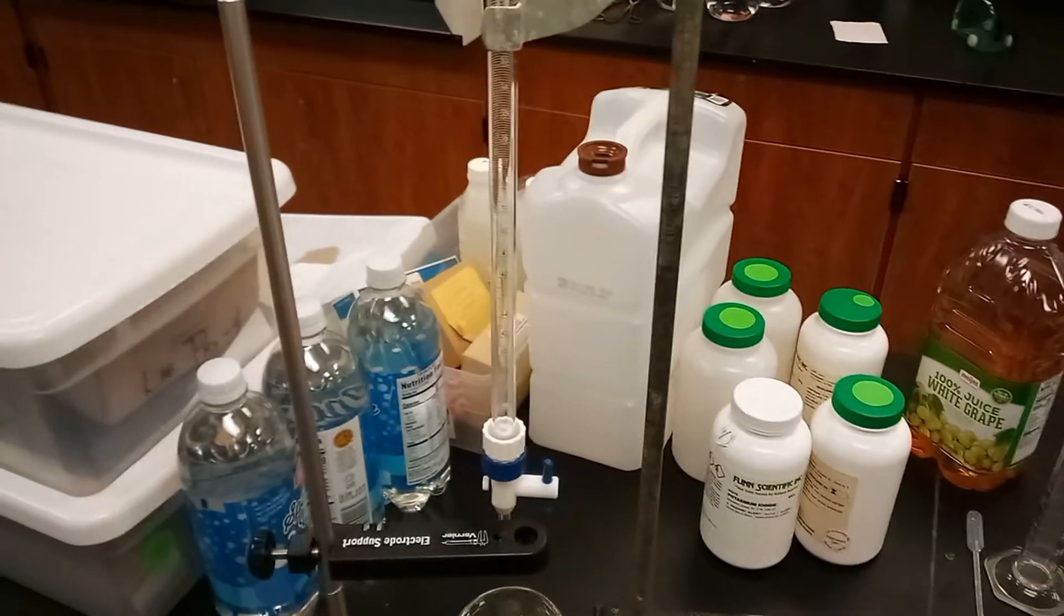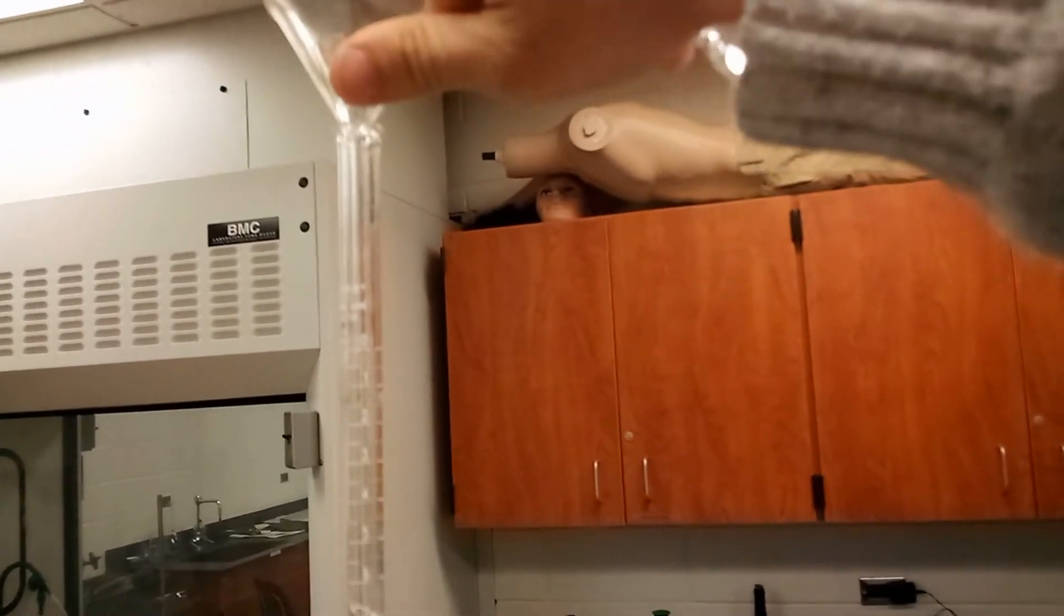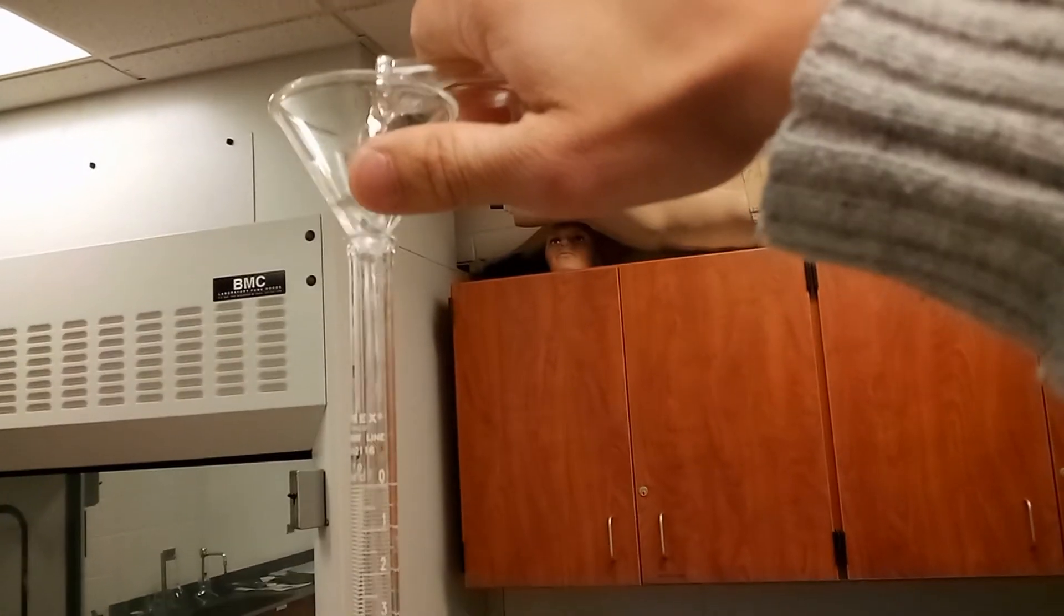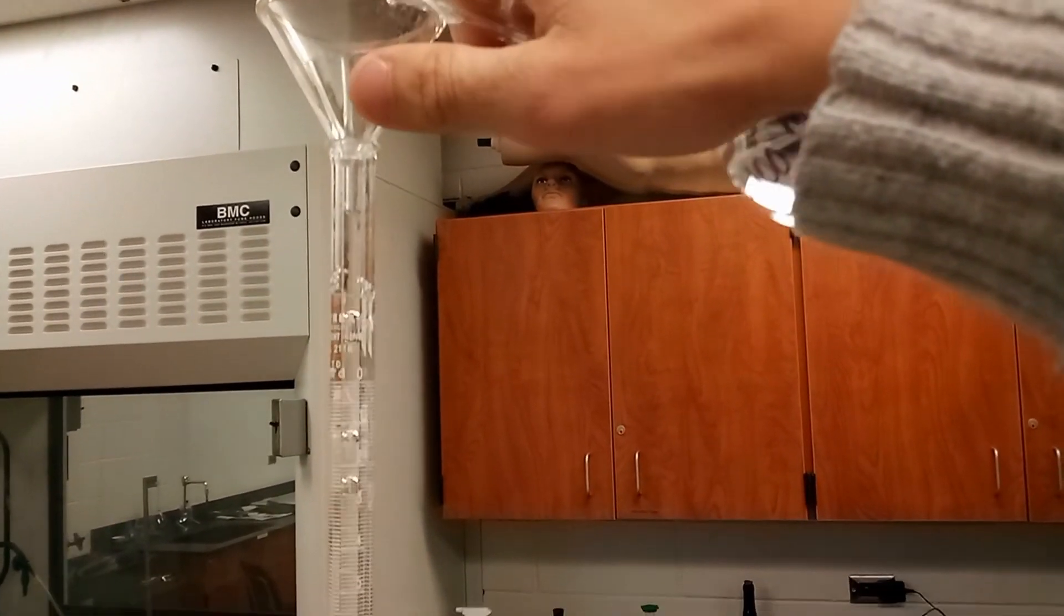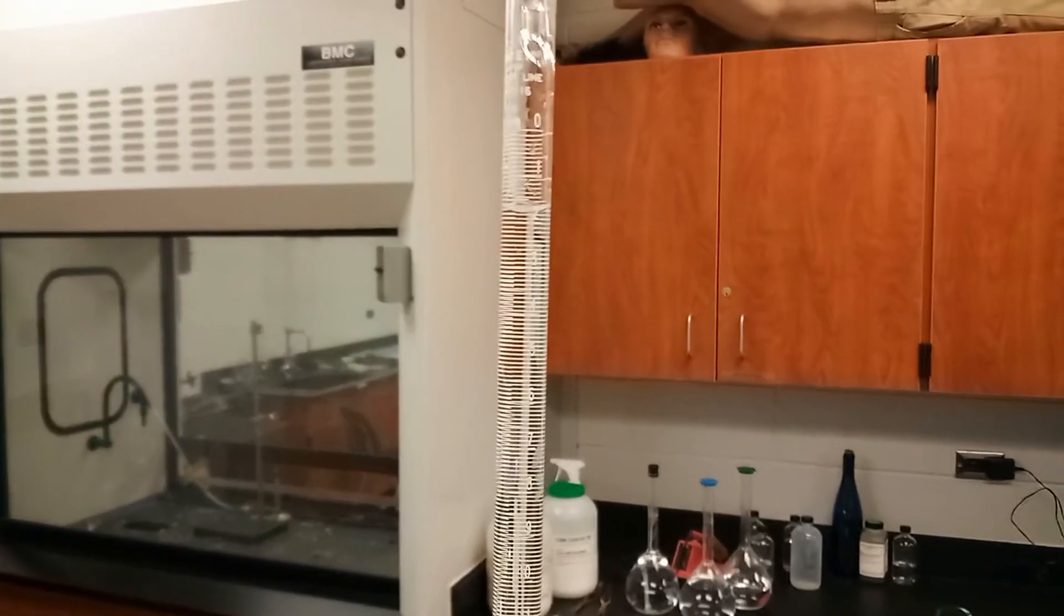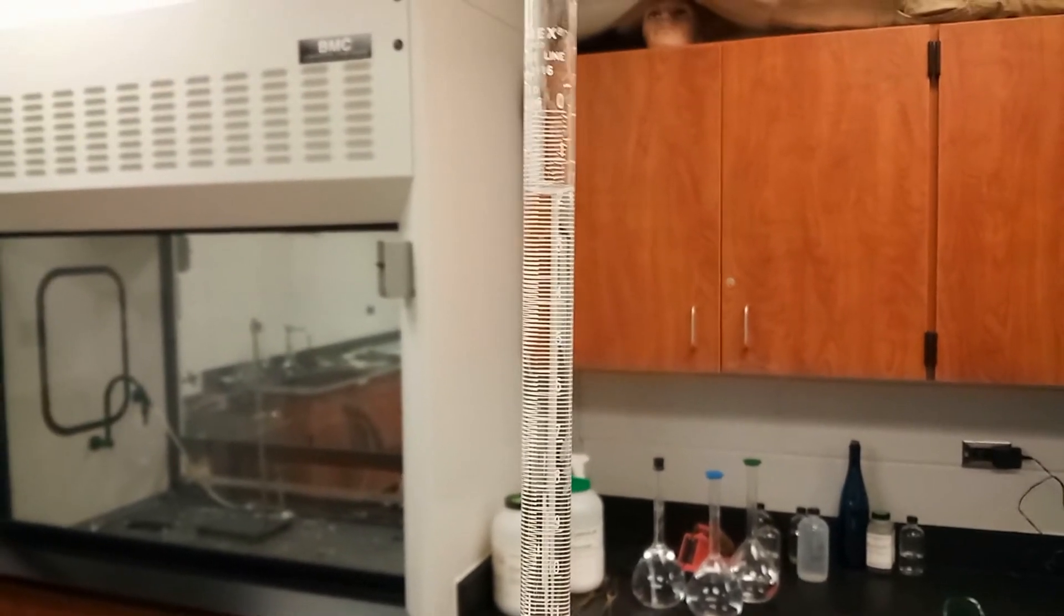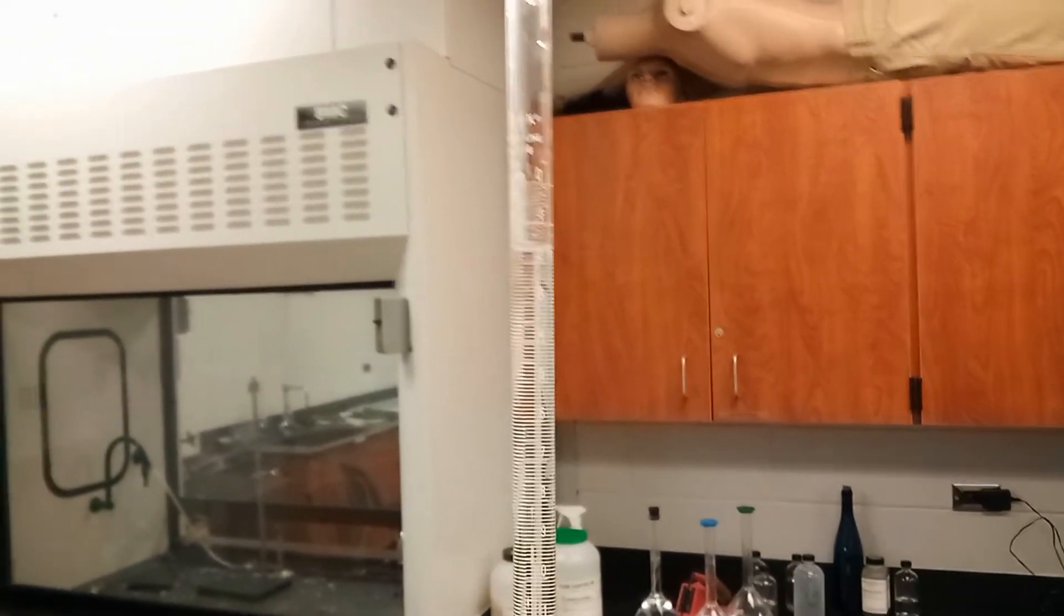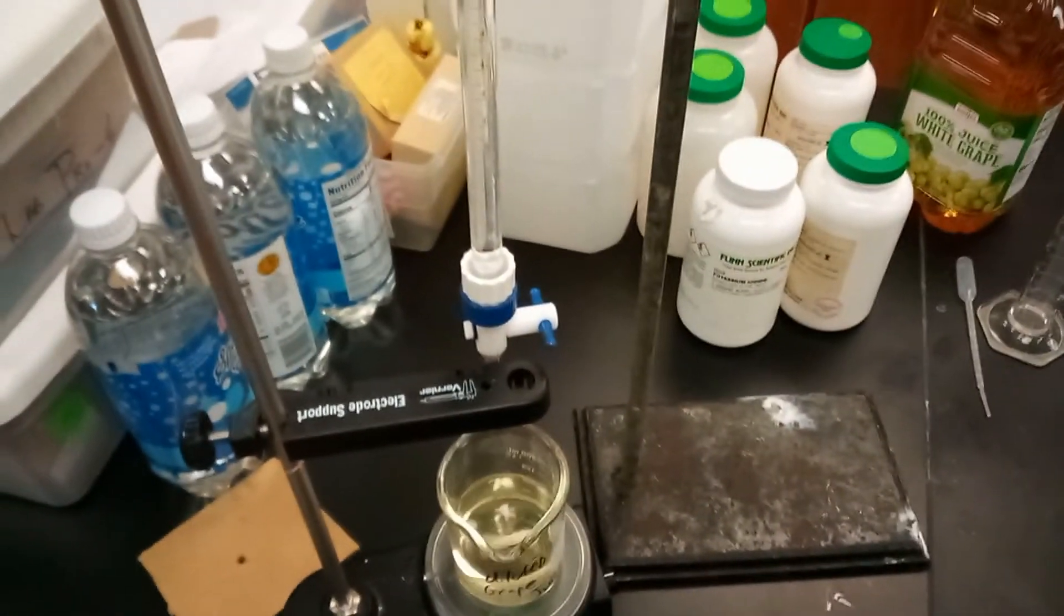But in order to do so, you are going to need one of these funnel things up here. I'm going to go ahead and just put some of our 0.1 molar sodium hydroxide into it until we get to some place near the top here. So you can hopefully see there that the line is just under the one milliliter mark. So that's a good place to stop there. We definitely know that we'll have enough sodium hydroxide because we almost have 50 milliliters. And there now we have added and filled up our burette so we can begin the lab.